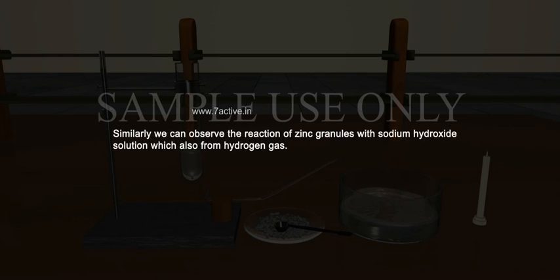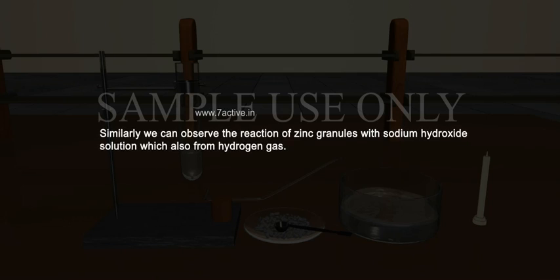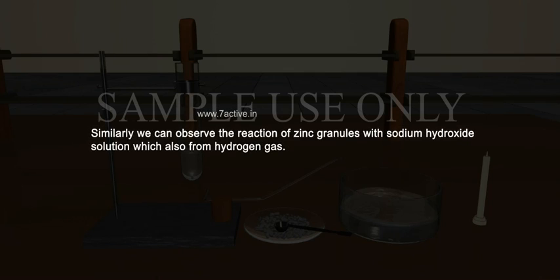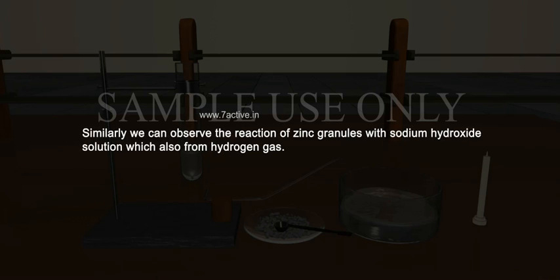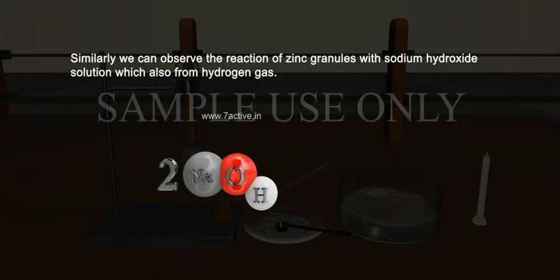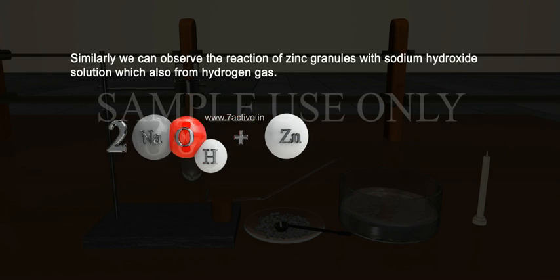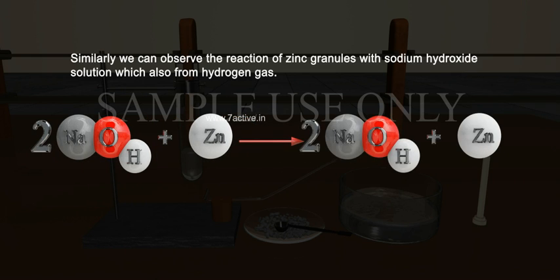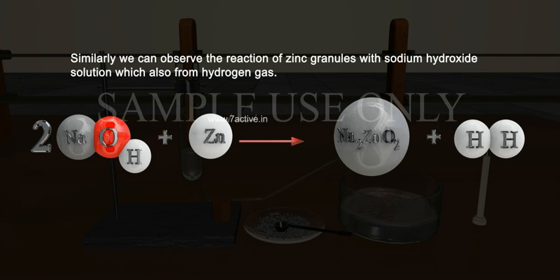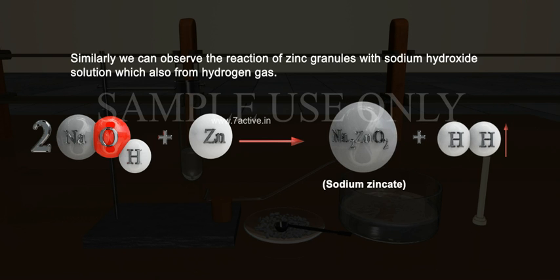Similarly, we can observe the reaction of zinc granules with sodium hydroxide solution, which also forms hydrogen gas. 2NaOH + Zn gives Na2ZnO2 (sodium zincate) + H2.